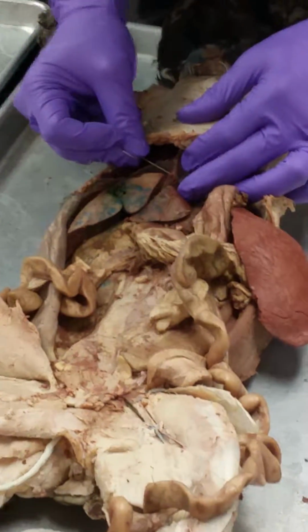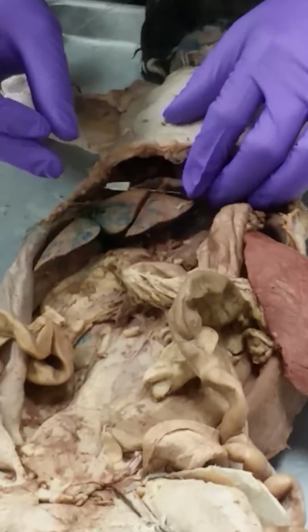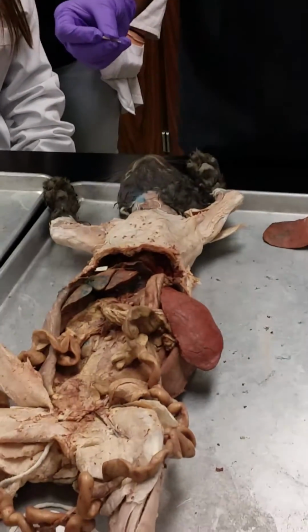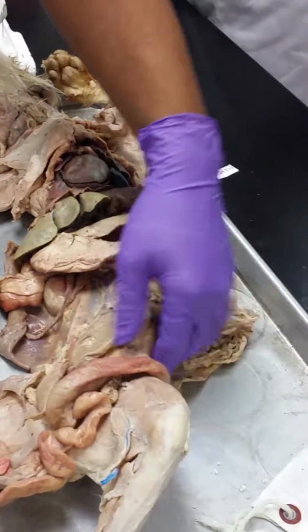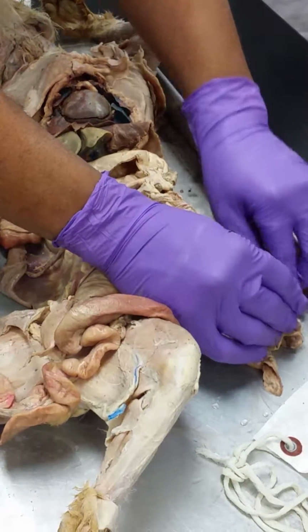Diaphragm. So right in there, falciform ligament. Is it easier to see somewhere else, maybe? Alright, what's next? 2? Greater omentum. So that was all that fat that we pulled to the side. So that fatty membrane. Greater omentum.